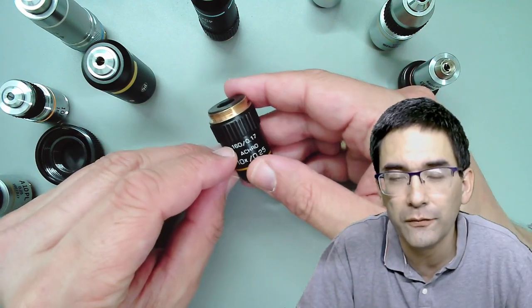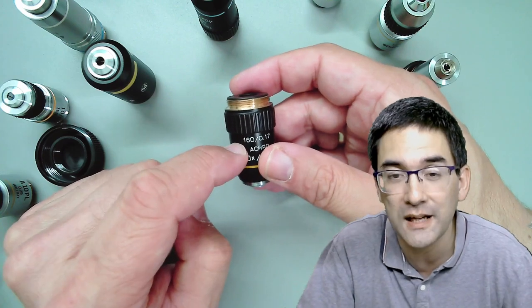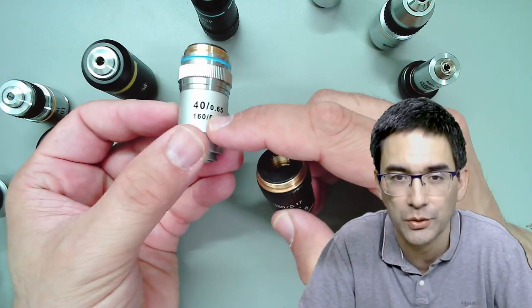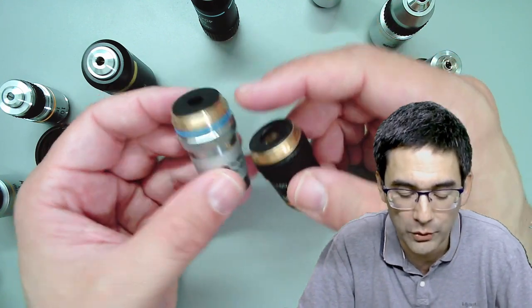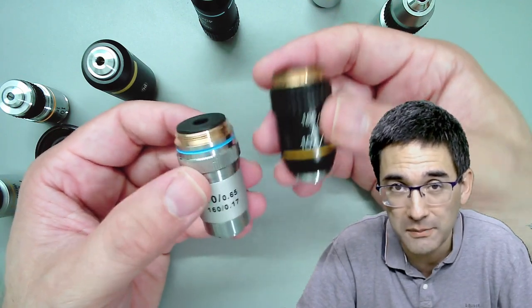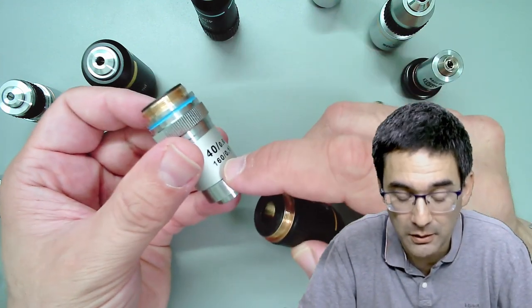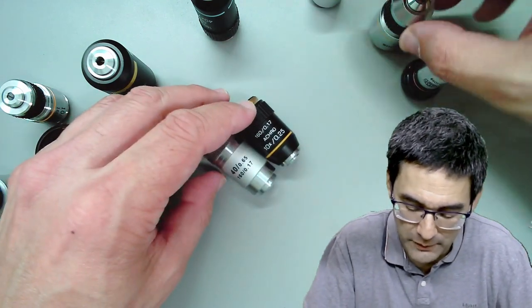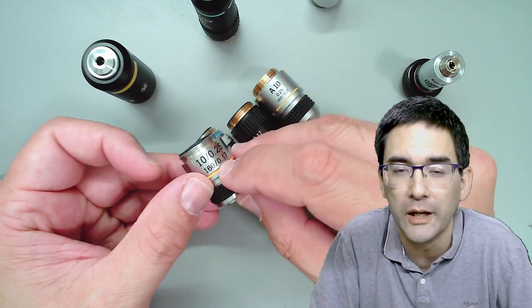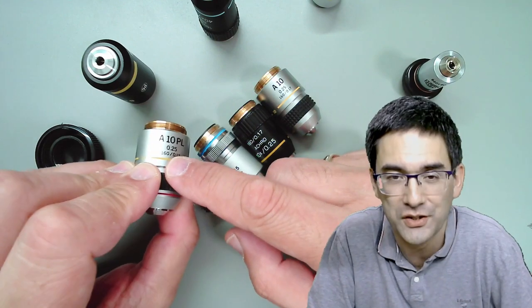The 160 refers to 160 millimeters of the mechanical tube length. Microscope objectives that have 160 printed on them can be exchanged with each other. For example, if I take this objective out and put another 160 objective in, it's going to work - both physically, since the threading (called RMS threading) will fit, and also optically. Most of my objectives have 160 printed on them.